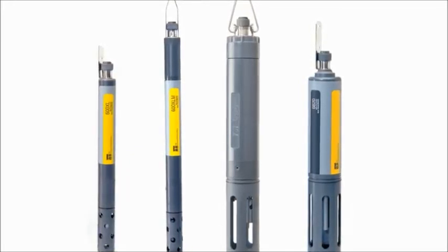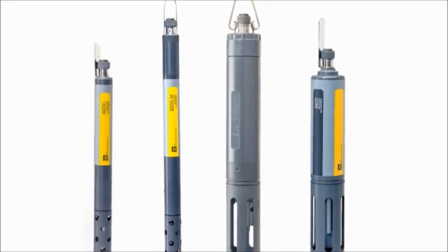In this video, we'll provide an overview of the most common probes, and also a few tips about using the 6 Series.